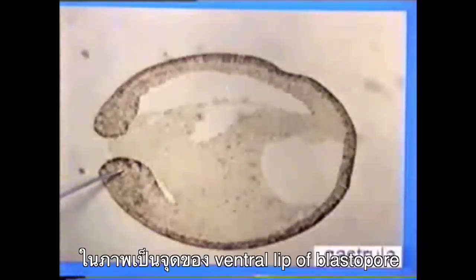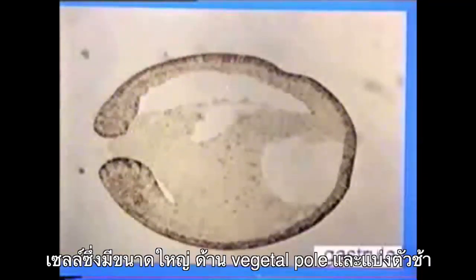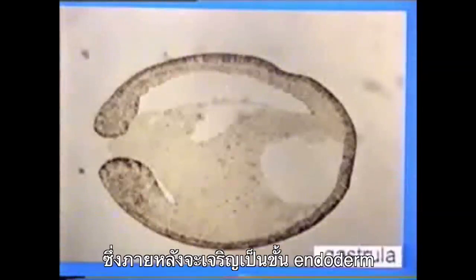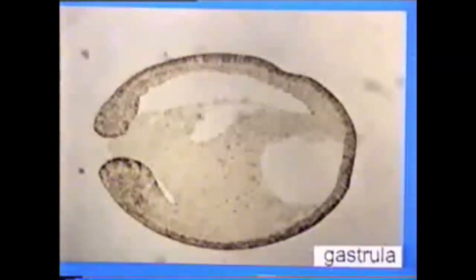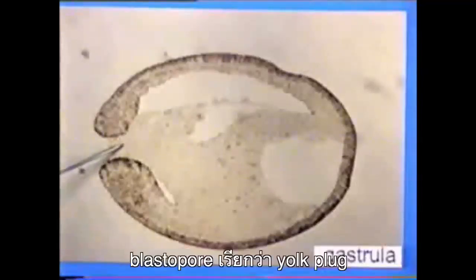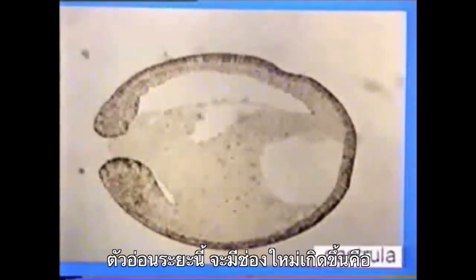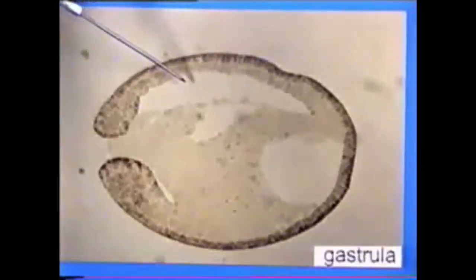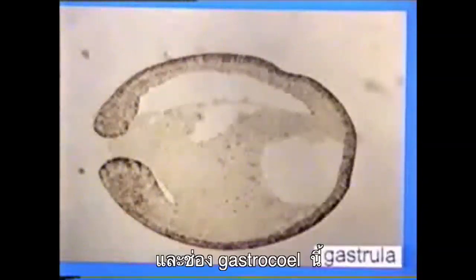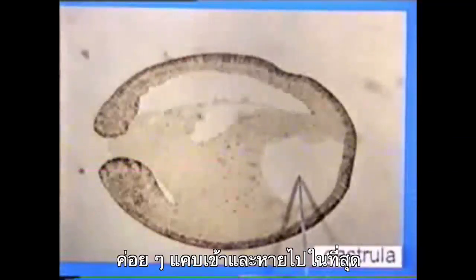This is the ventral lip of the blastopore. Larger cells at the vegetal pole divide slowly and get pushed inward. In the end, most of these cells will be the endoderm. However, some cells remain attached to the blastopore — this is called the yolk plug. At this stage, the embryo has a gastrocoele which will develop into a primitive gut. In addition, the size of the blastocoele gets smaller and eventually the blastocoele disappears.